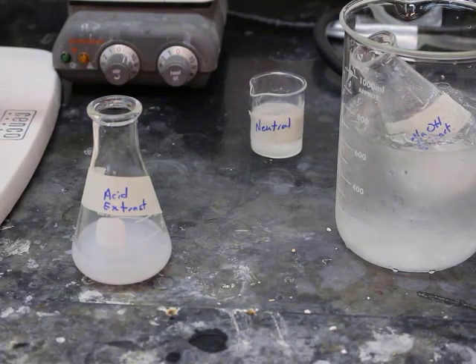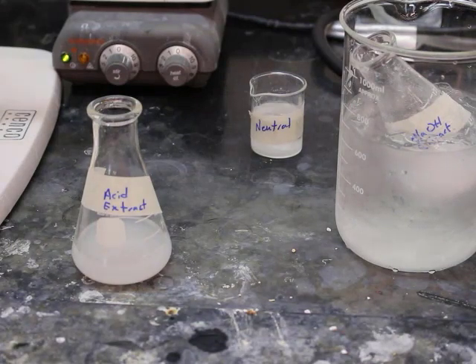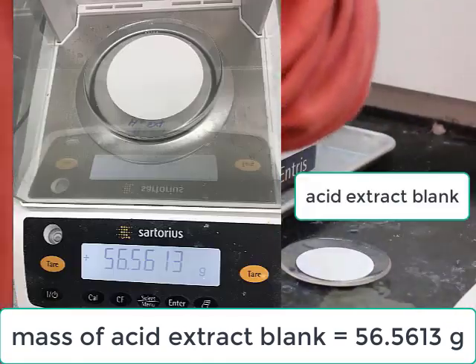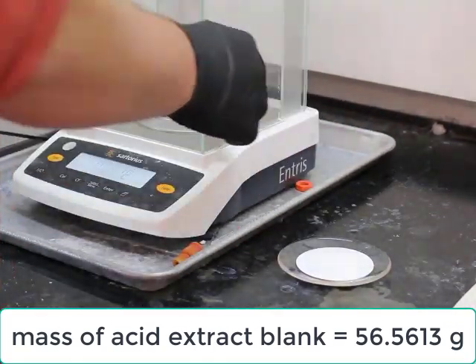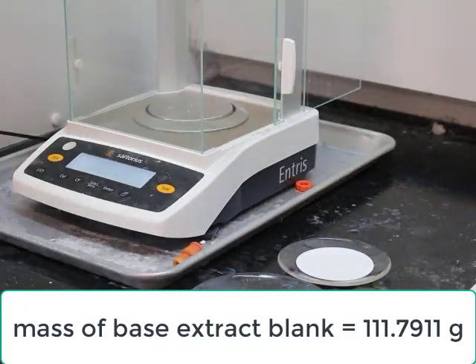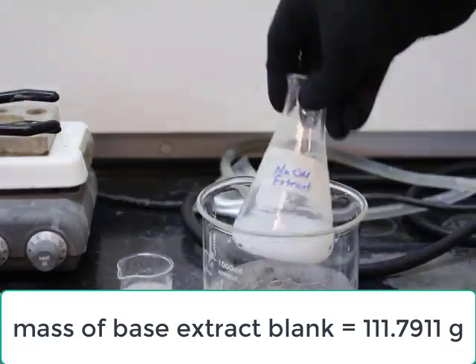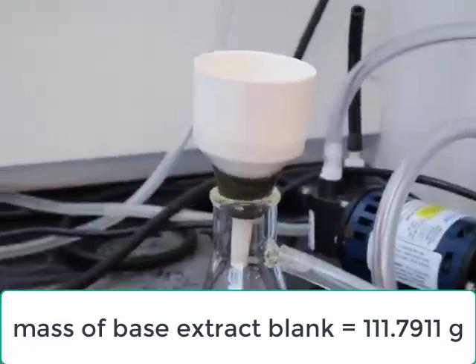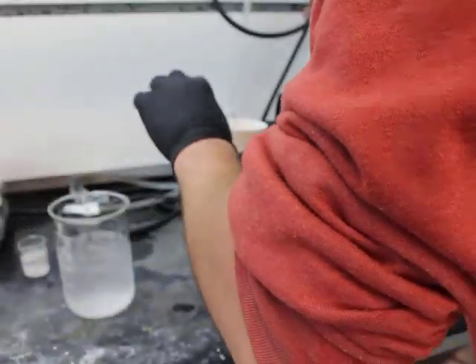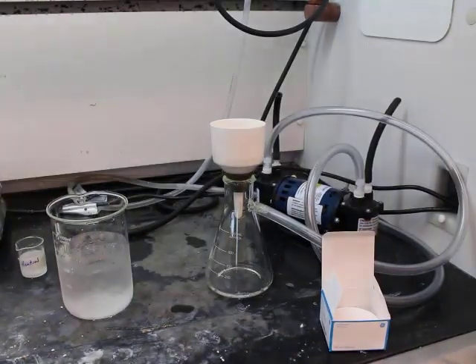All right, so now that we have both of our solids, going to weigh out our watch glass and filter paper so that we can do a vacuum filtration. First up, we're going to look at the mass obtained for the acid extract blank. All right, so 56.5613 grams. Then the mass of our base extract blank was 111.7911 grams.